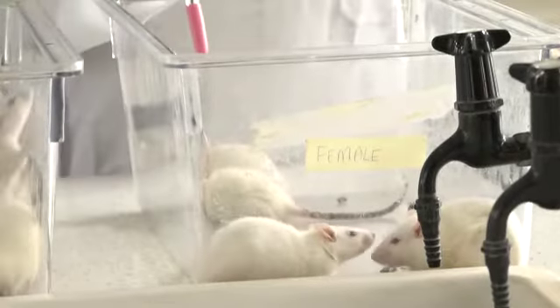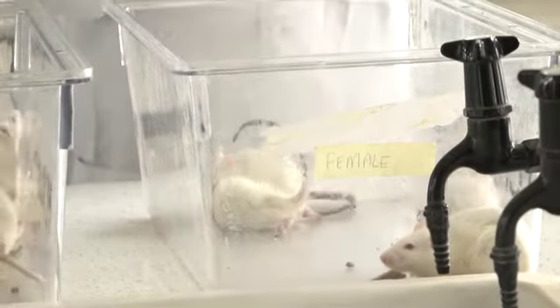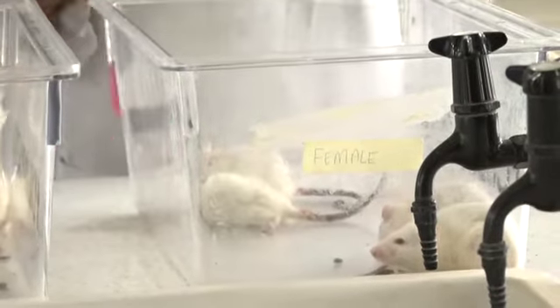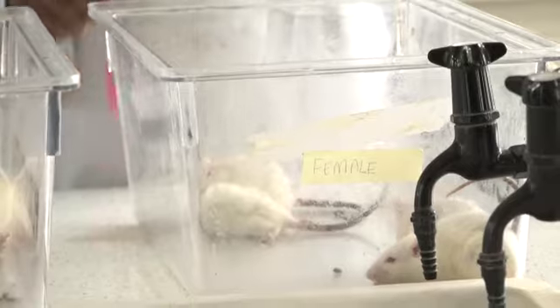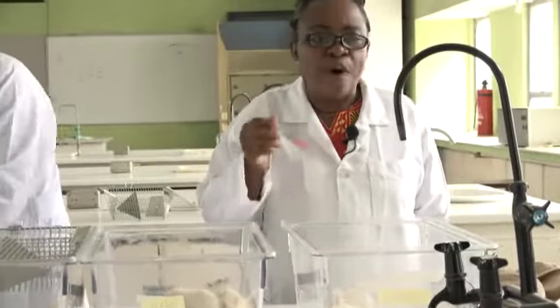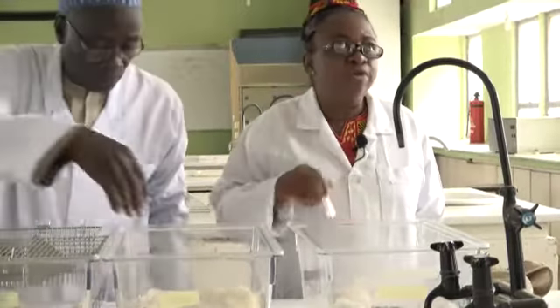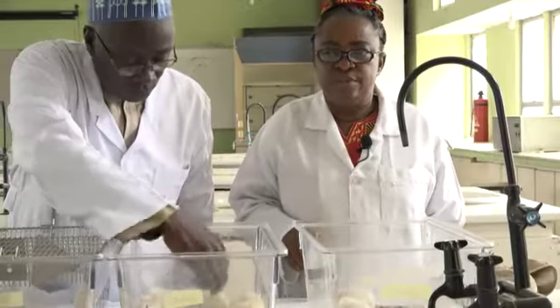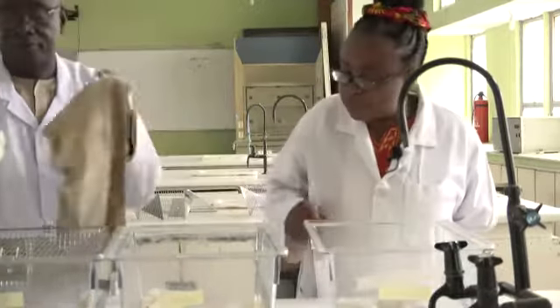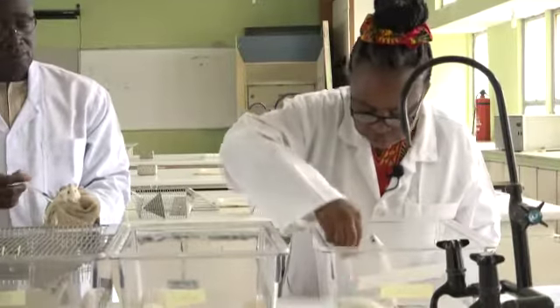Now, why is this one reacting so badly and the others are still alert? This one is even exploring, though this one is beginning to feel the effect of the poison. It's as a result of biological variation. Even if you give the same dose to a group of persons, they will all respond in different ways and at different times. This one, the others are going to show the signs of toxicity, but it may take a while. So what I expect you to do is to note the time that you observe all this toxicity.